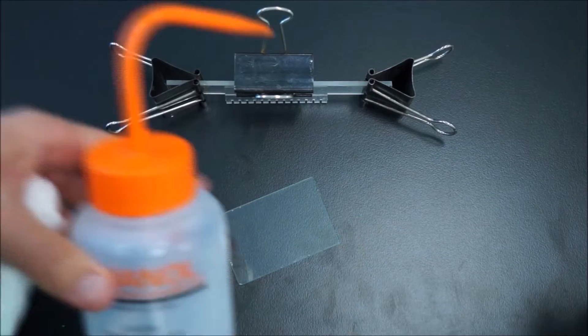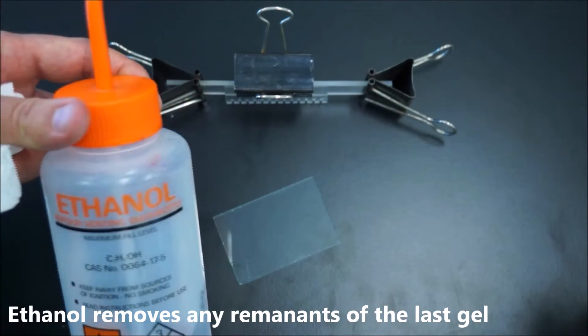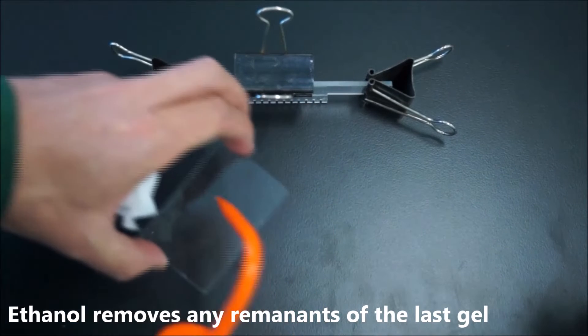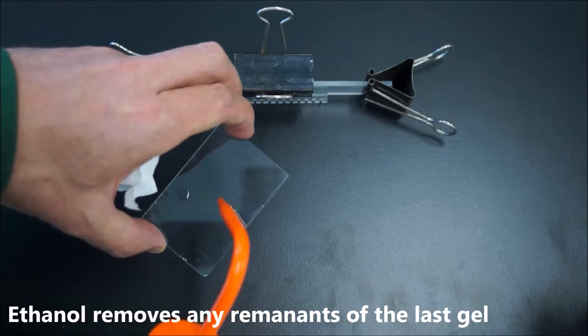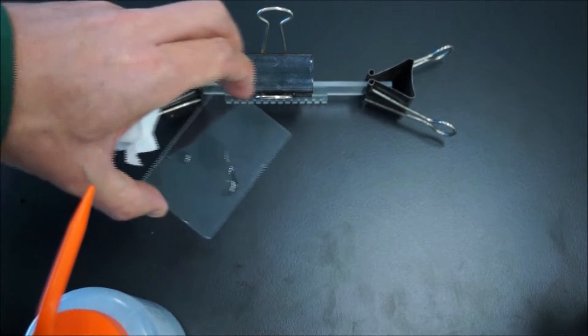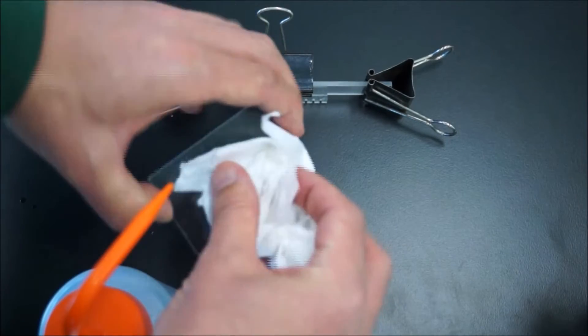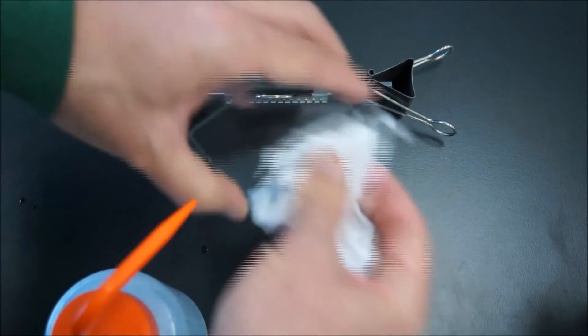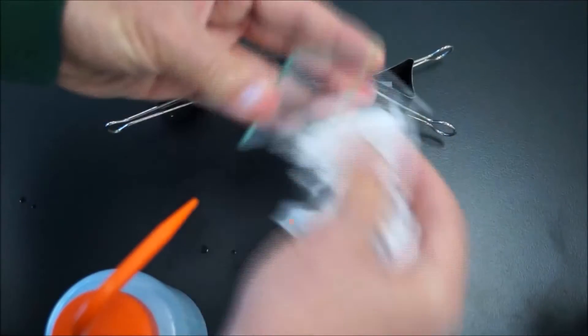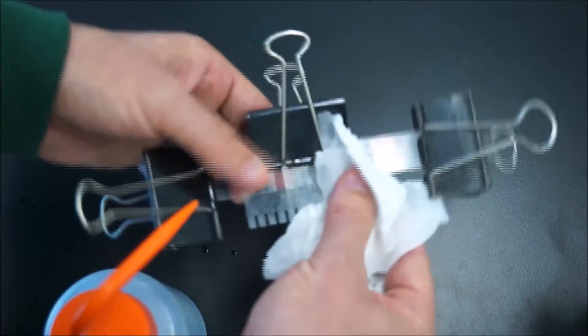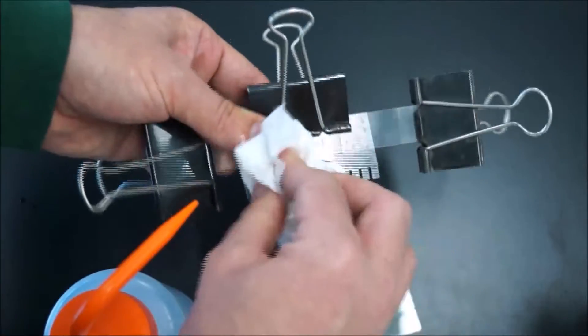I would clean these instruments before use because you don't know who's had whatever gunk on there before. Just use a little bit of ethanol and give it a good rub on both sides to clean it, and also your comb. This one's filthy and probably needs a clean.